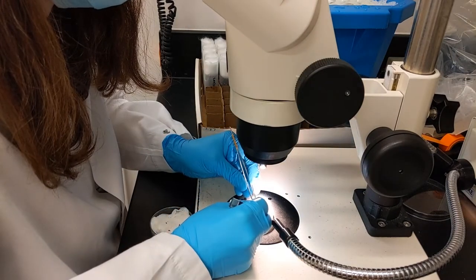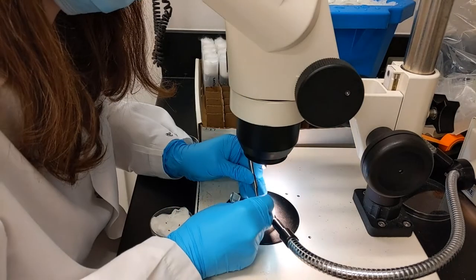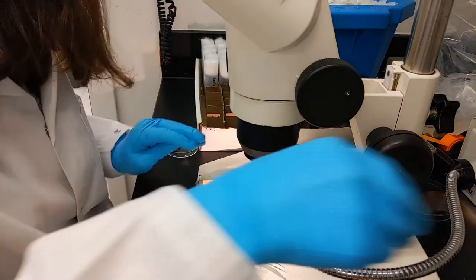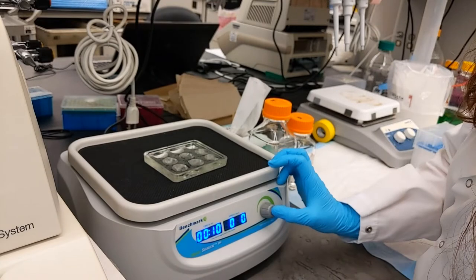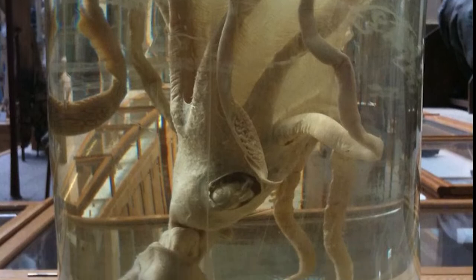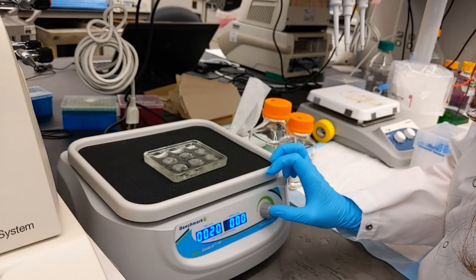That only took me about a minute and a half. Now that you have some beautiful brain samples, the next step is fixing them. When I say fixation, I mean that I will soak the samples in a chemical called paraformaldehyde. You have probably seen some jars with samples full of paraformaldehyde in a natural science museum or just some creepy basement. Fixation takes about 20 minutes and you just have to wait for them to be done — dance break!